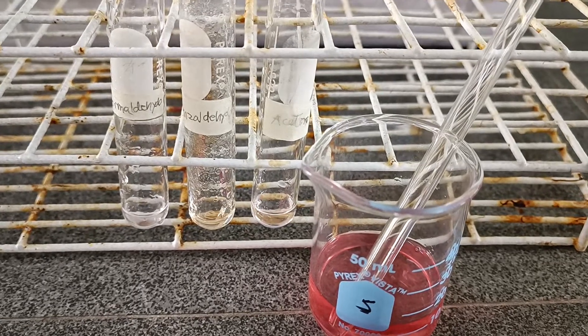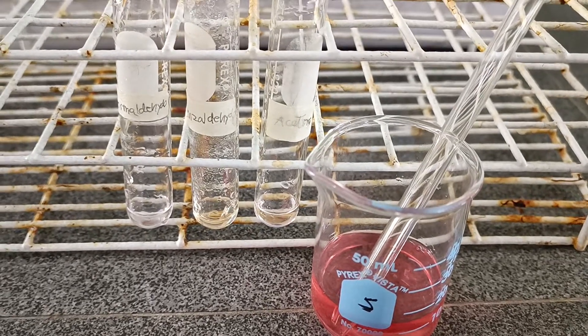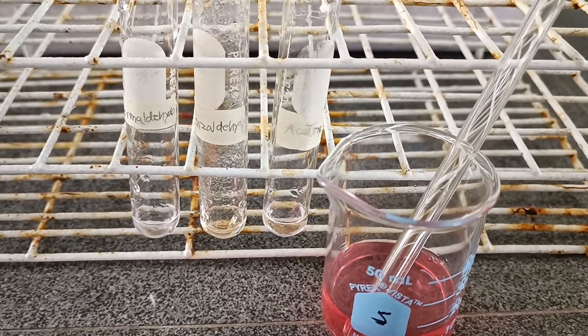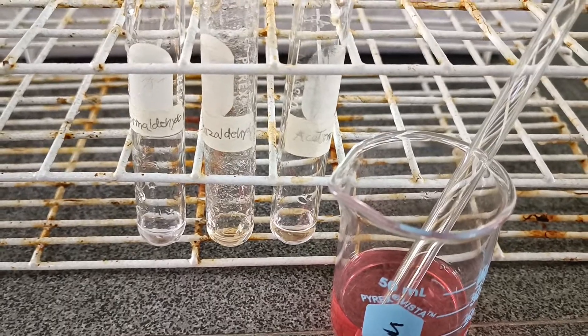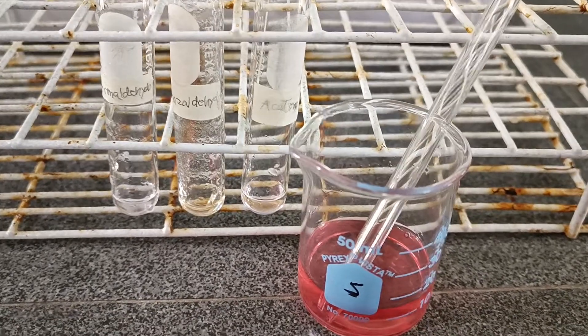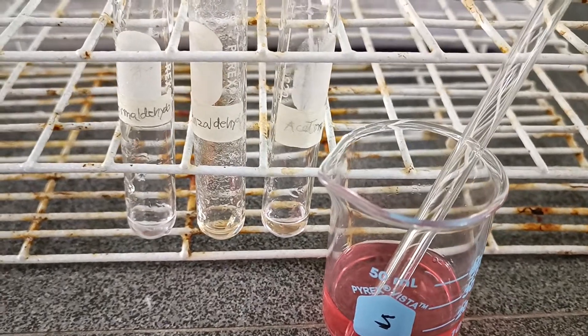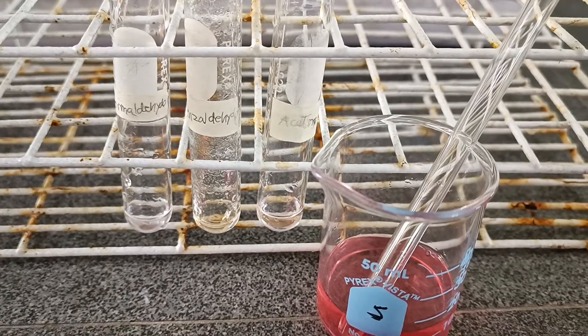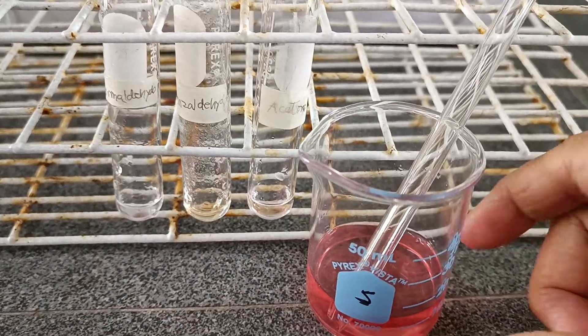Hello, I am doing a Schiff's test for aldehydes and ketones. The samples are formaldehyde, benzaldehyde, and acetone.